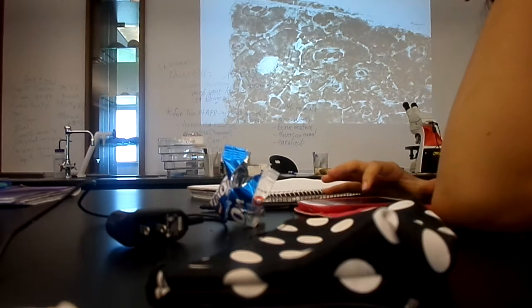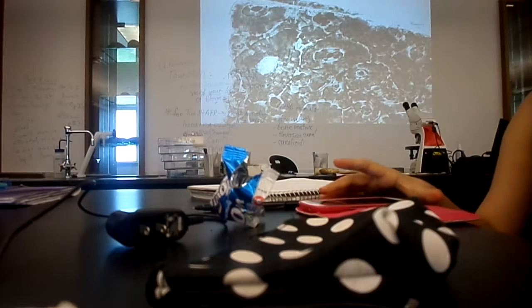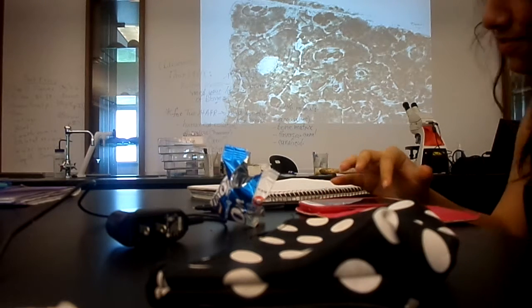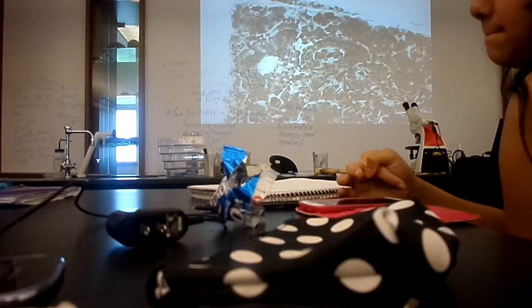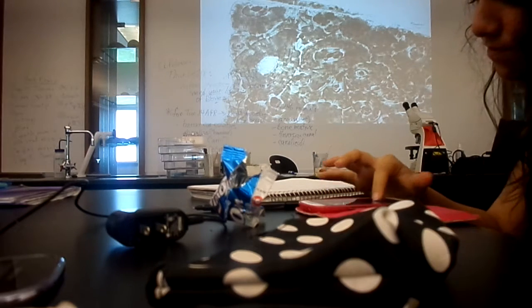You can see that the bone cells have that oval shape just like the lacuna, but these structures that project off of the major part of the cell body are kind of like the pseudopods of an amoeba, because this is cytoplasm with the surrounding cell membrane.